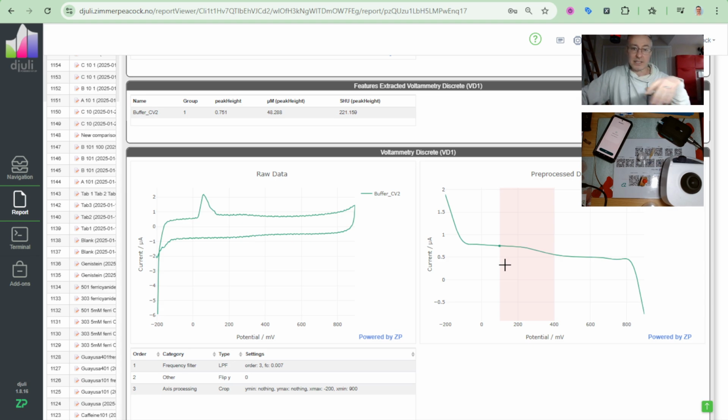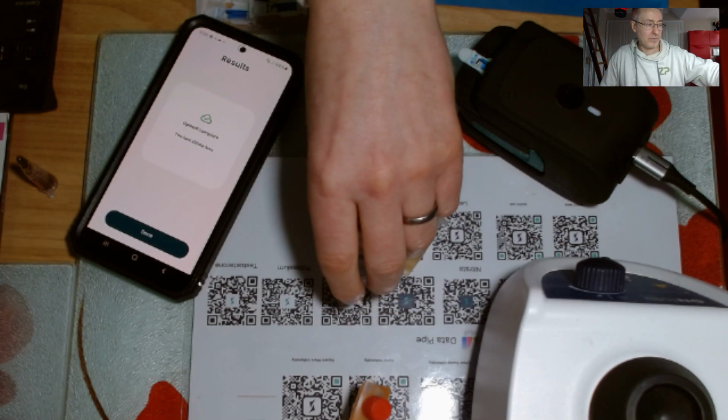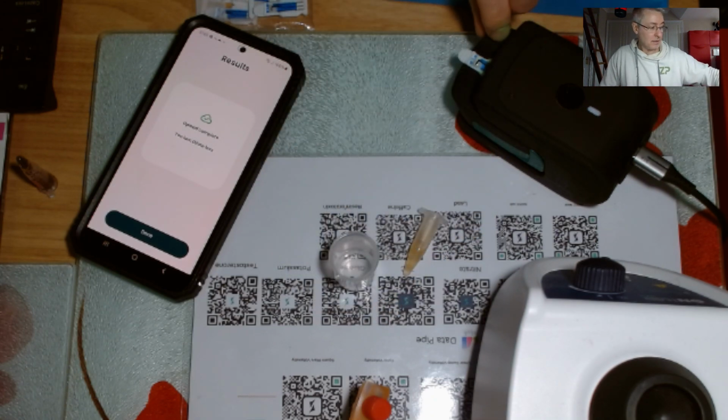Now, in that case, I did something myself, which was, you saw me, I took the buffer and I put it on there. So you can end up with very flat, uneventful signals in the region that we're analyzing, because somebody, and it's no criticism of people, this happens, I've obviously done it myself, that's what can happen. So let me go forward now with a bit more of a demo, because now I've realized, oh, I must have put the buffer on there. That's a bit silly of me. Okay, no sweat. All right, I'll take my sensor out. Bit of a shame, but okay, we've done it.